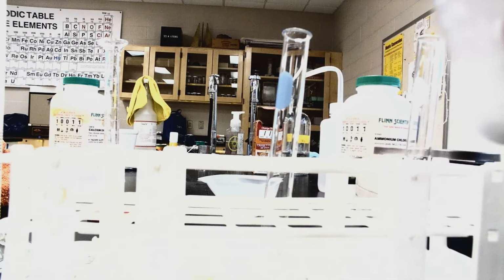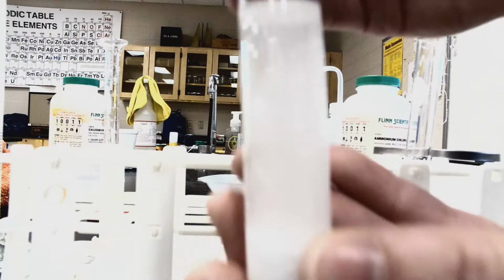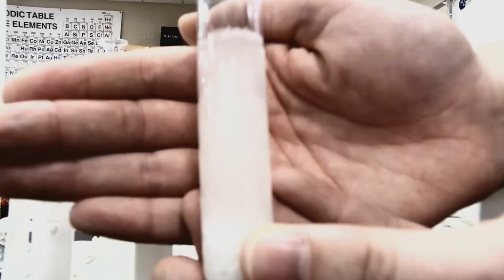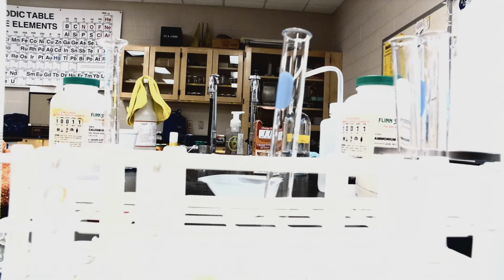Kind of feels like a warm pack, where the last one kind of feels like a cold pack or an ice pack. Looking at this one, if we're looking at our chemical reaction, once again, it's a very milky type of color, but there is a chemical reaction occurring. All right, moving on to C.